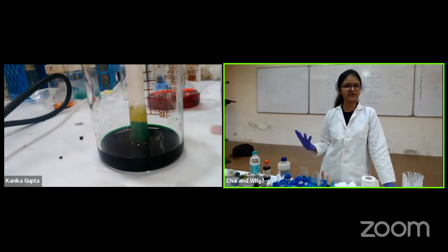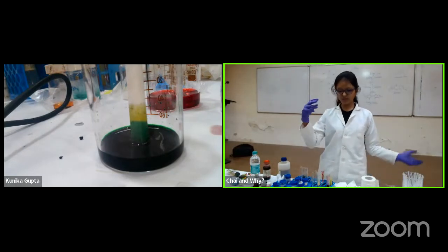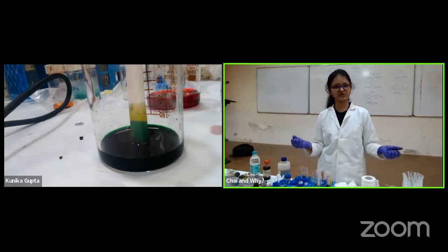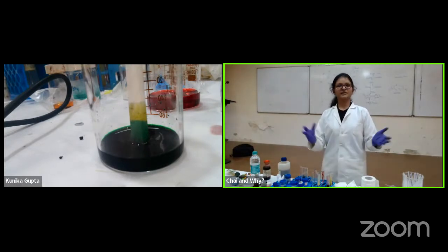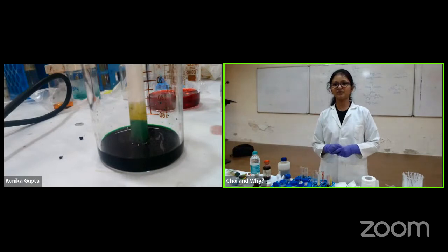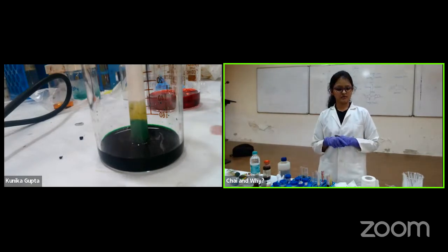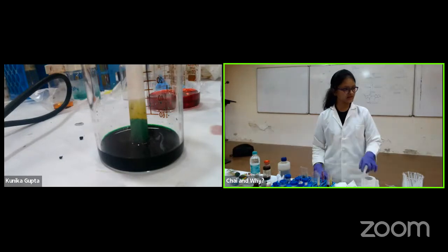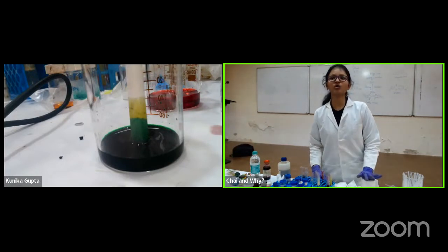So I hope you have got a glimpse of how these things are actually done in a chemical laboratory, where we have all those beautiful colors. We just mix them together, not randomly, obviously, with some strategy, and that results in a desired compound. So here I have shown you a reaction which I know is successful. You can see that with time, the yellow color is getting even more separated from the green one. So that's exactly how chromatography works.